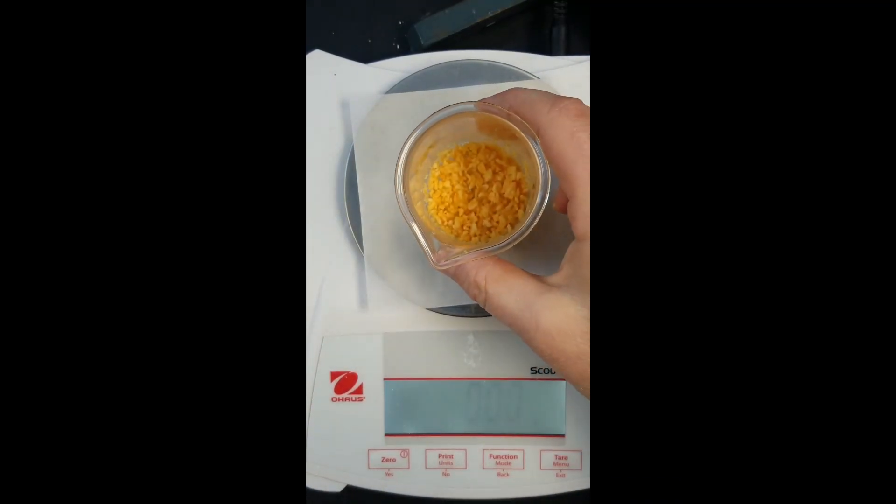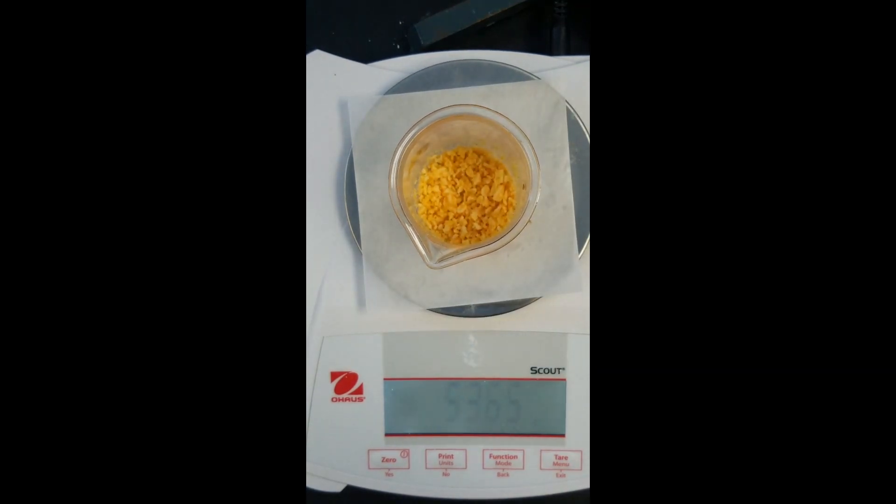Now that they're all crushed up we want to record the mass again. And it's important to do it at this point in case you lose any chips while you are crushing the chips.